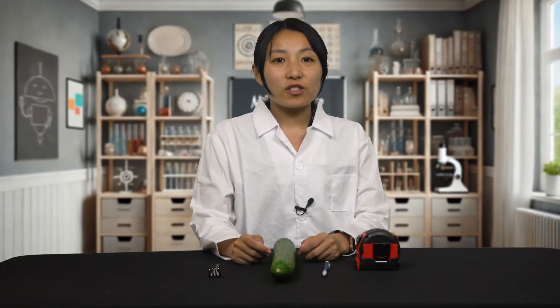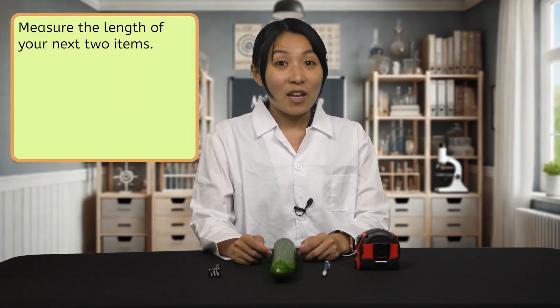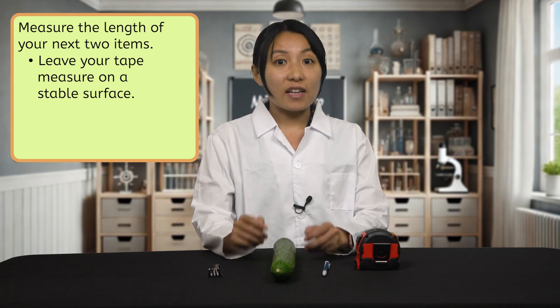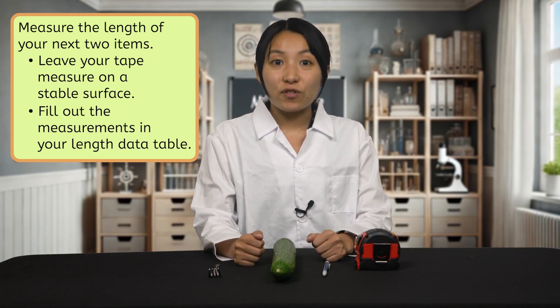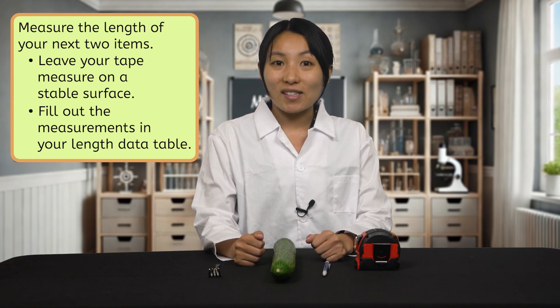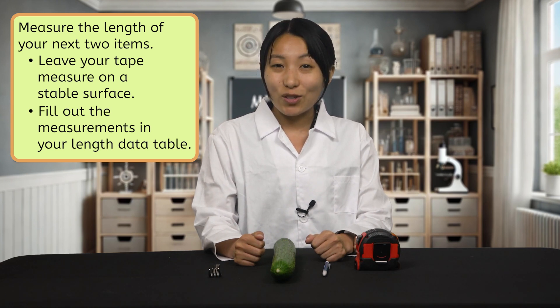Repeat this procedure to measure the length of your next two items. Be sure to leave your tape measure on a stable surface the whole time. As you complete each measurement, fill out the measurements in your length data table in your interactive lab notes, including the unit of measurement you used.